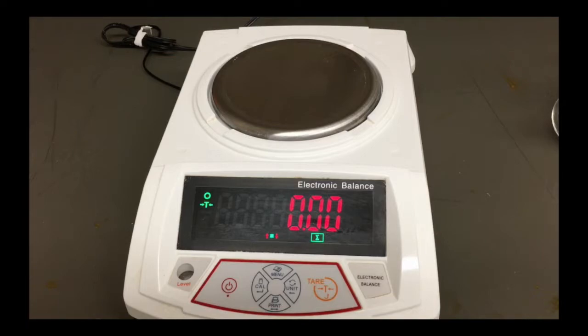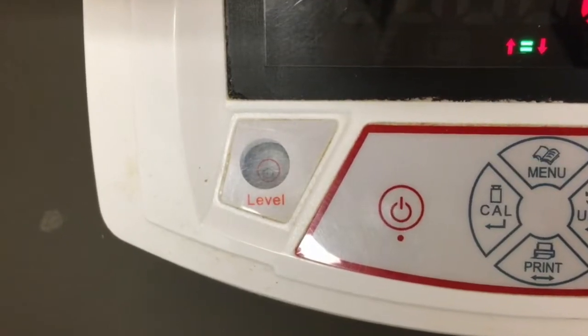Before weighing out the powdered media, ensure your balance is level by checking that the air bubble in the built-in level is centered.